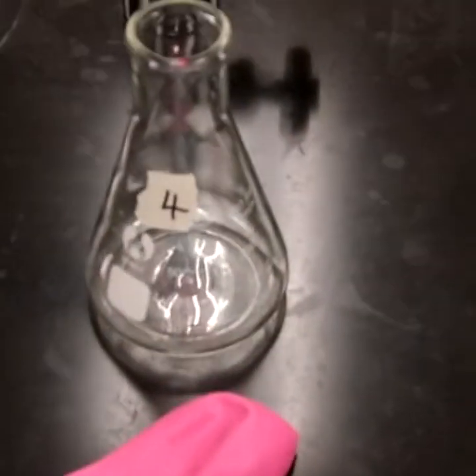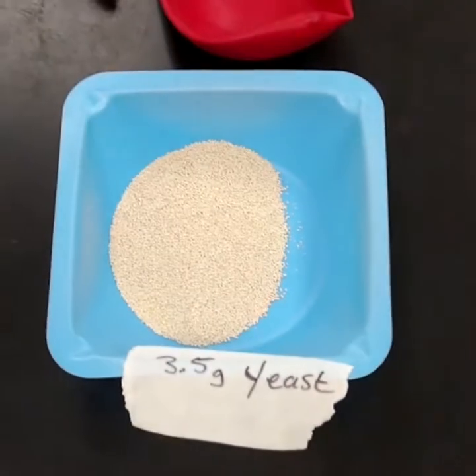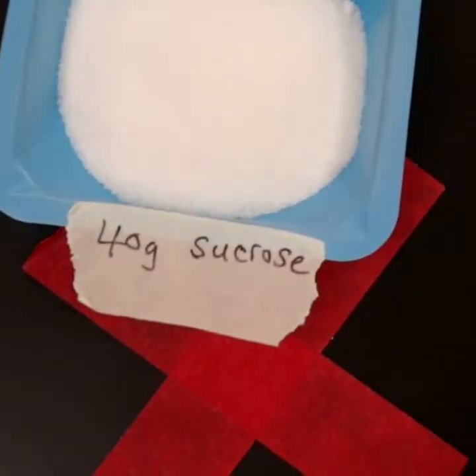Flask 3 will be set up again, 3.5 grams of yeast, 40 grams of sucrose. Flask number 4, the yeast, no sucrose. 5, again, the same amount of yeast, 10 grams of sucrose. And number 6, so 3.5 grams of yeast, 40 grams of sucrose.